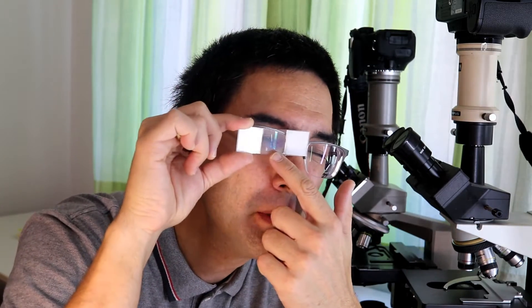If I move the object to 125 millimeters from my eye, I have a magnification of two and the diameter appears twice as large. I can keep doing this, but only up to a point — sooner or later my eye is not able to focus anymore. For a 10x magnification, I would need to place the object at 250 divided by 10, which is 25 millimeters — two and a half centimeters in front of my eye — and that's obviously not possible for my eye to focus on.